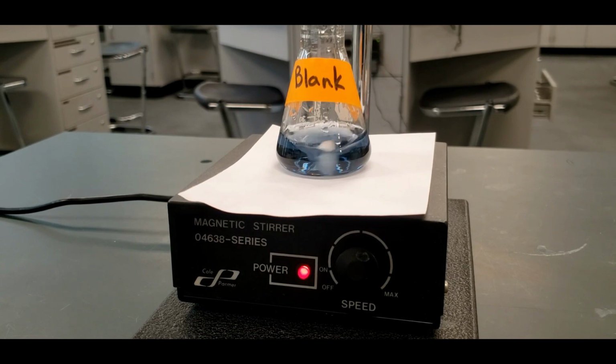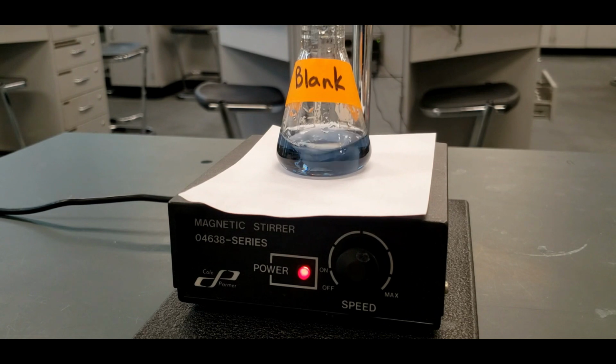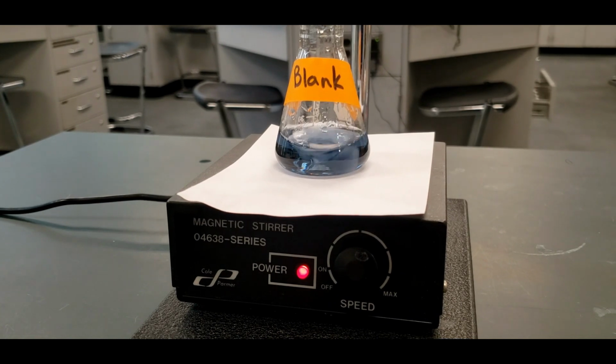All right, wanted you to see this. This is about 2 or 3 minutes after I was done with the titrating, so you can see it's deepened in color even more. It's got more of a gray tint to it. So we definitely hit the end point as I thought, and that's what I said, that the reaction takes a little time to come to completion, but we are definitely there, and that's what we should be looking for in the other titrations as well.